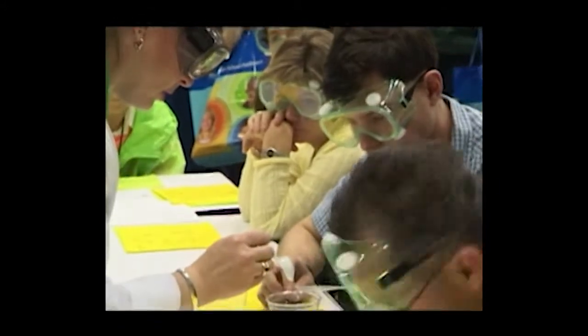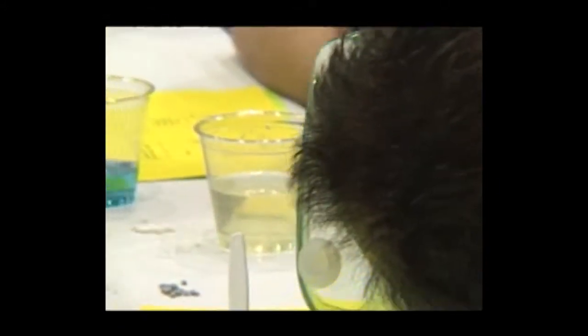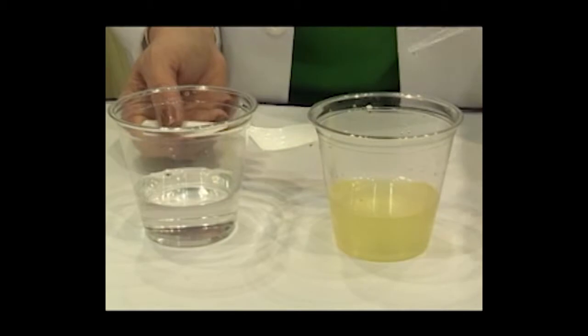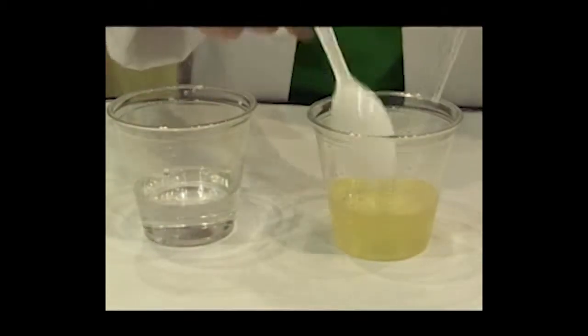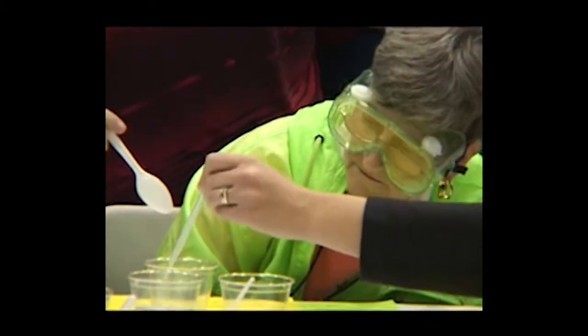Okay, you've got one sinker now. There you go. We are going to keep adding water and stirring after each addition until one of the pellets sinks.